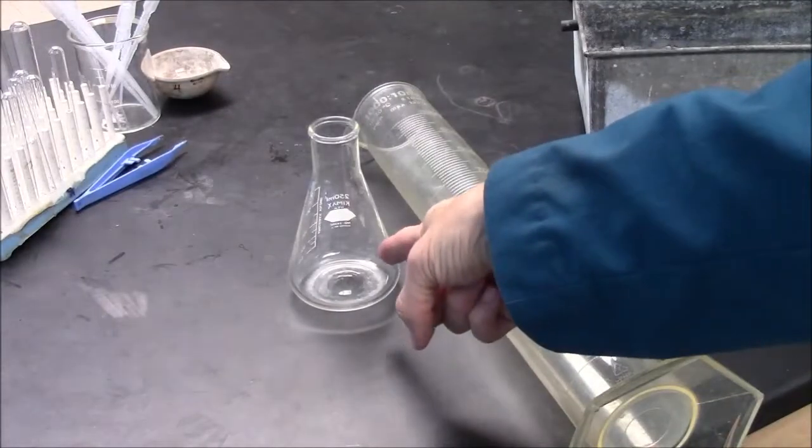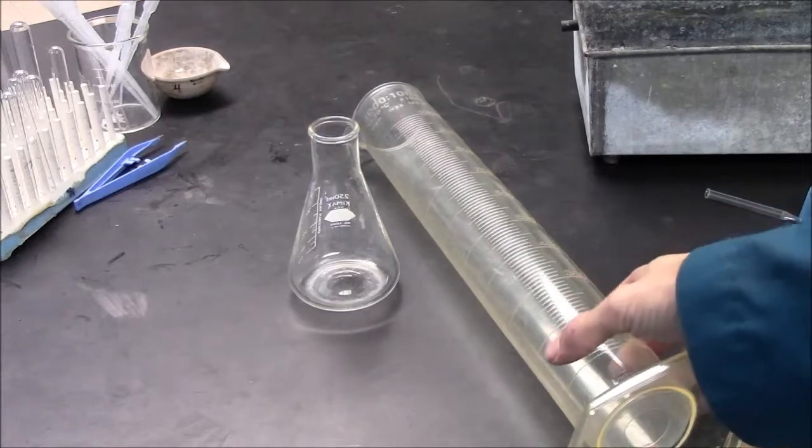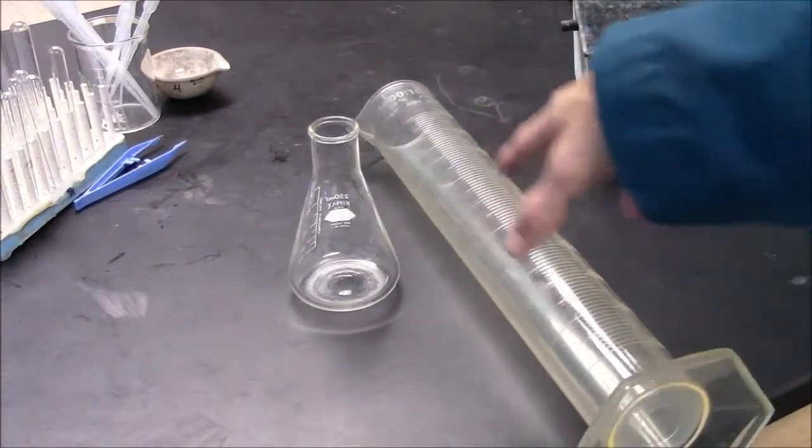You'll make your gas in a flask by running a reaction, but collect the gas in a large graduated cylinder.